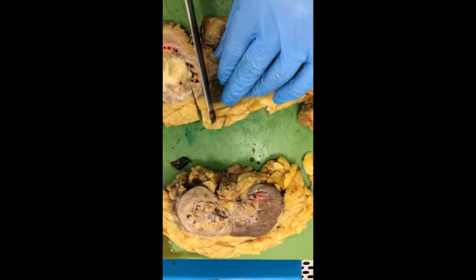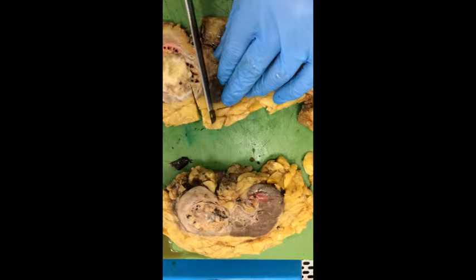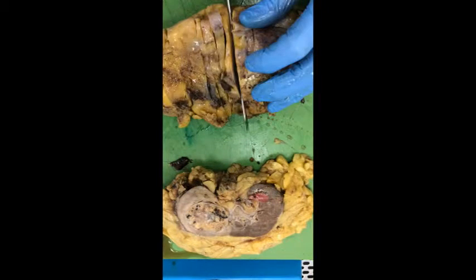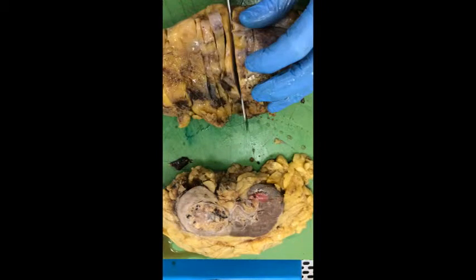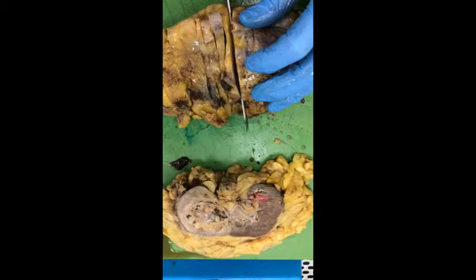Then take blocks from the kidney tumour itself — at least one block per centimetre. Pay attention to where the tumour is white or where it's haemorrhagic.